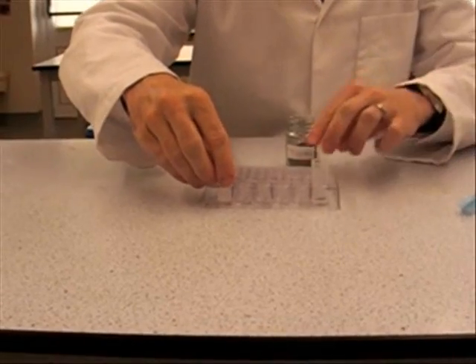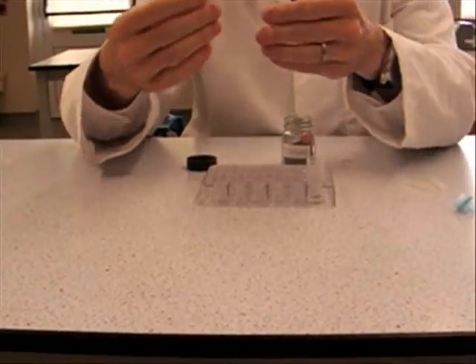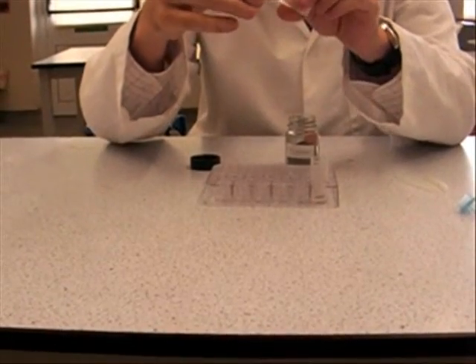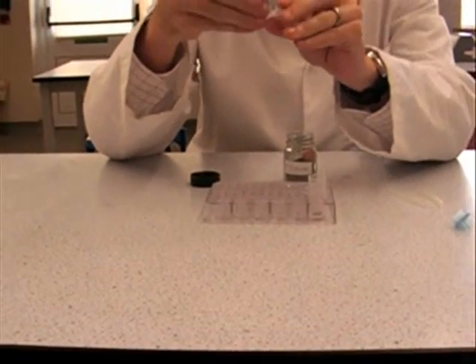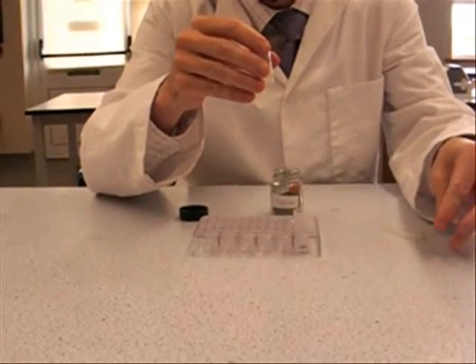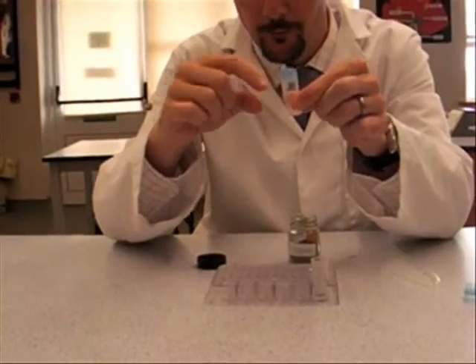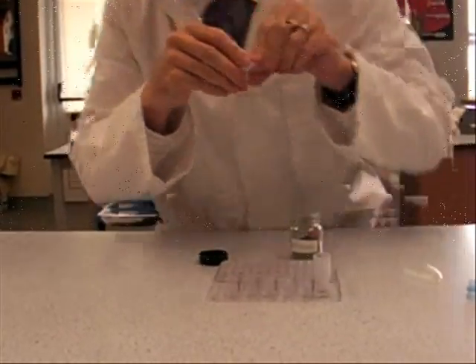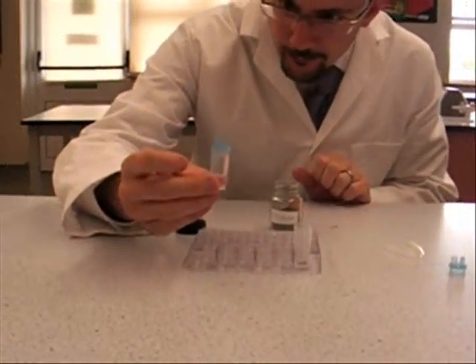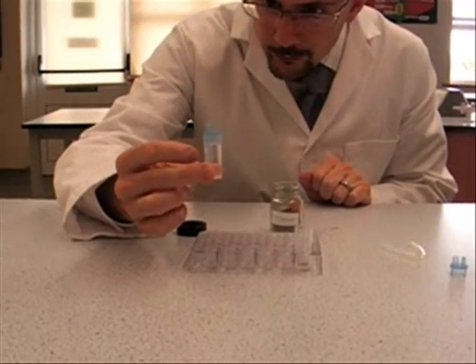The other one is going to have water in. And it's got to be enough water so that when you pop this on, that the water is touching this little tube here. You'll see why later. So I'll just add some water to that. So as you can see, the little tube is touching the water.